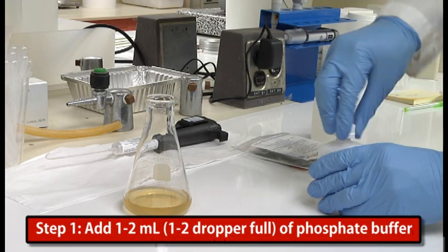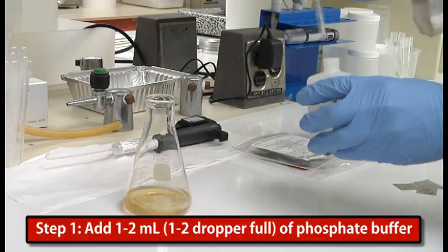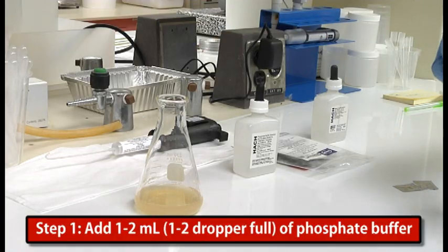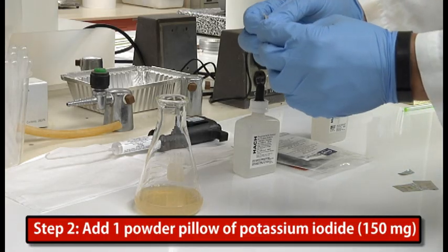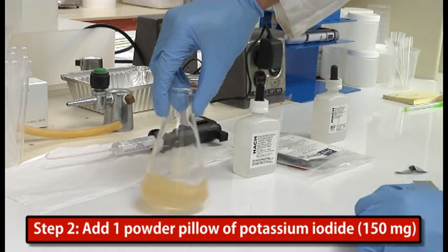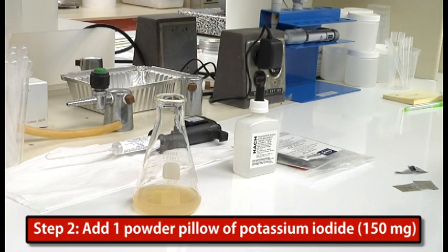First, I'm going to add our phosphate buffer. This ensures that our sample is kept at pH 7 and we're only measuring chlorine dioxide in our analysis. Then I'm going to add 1 powder pillow of potassium iodide. The potassium iodide is going to react with the chlorine dioxide in the solution. The chlorine dioxide is going to oxidize the iodide and form a yellow complex, which is directly proportional to the amount of chlorine dioxide in our sample.